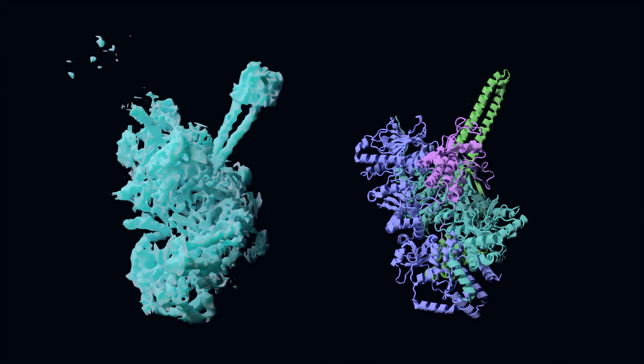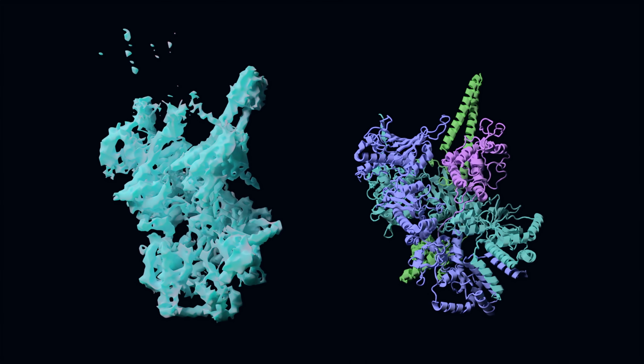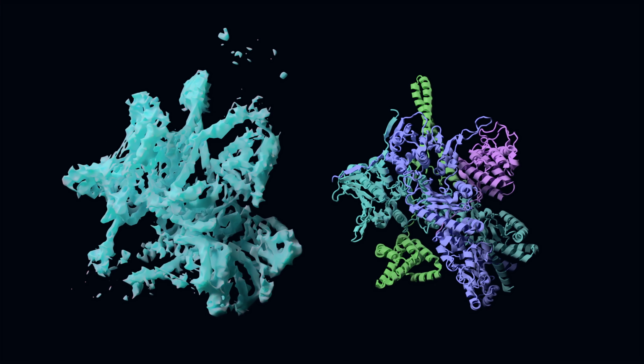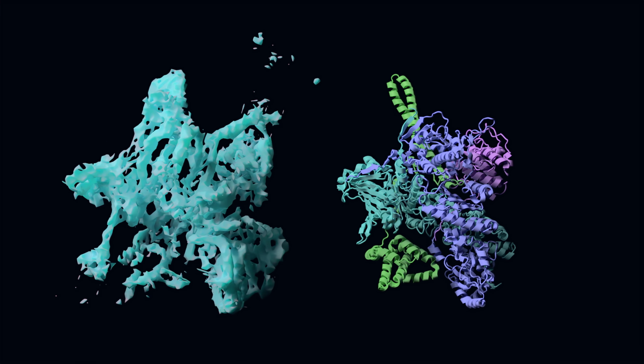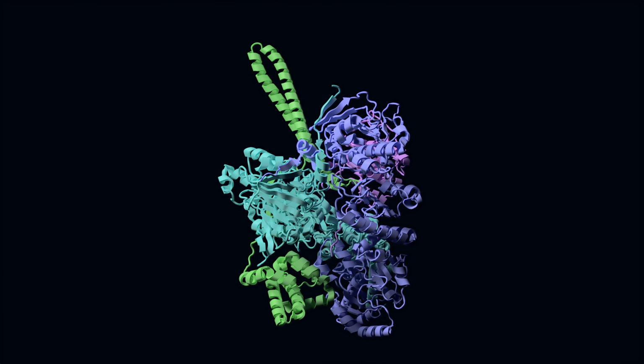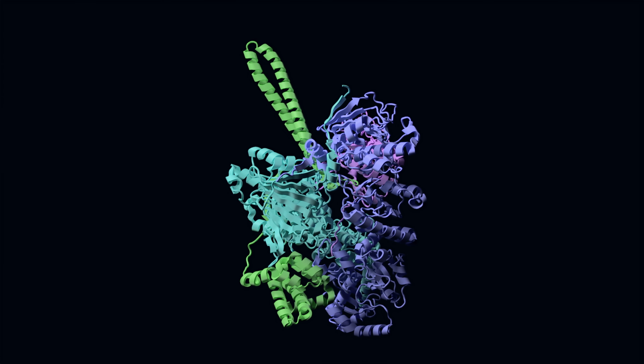Next, AlphaFold-predicted structures, or any other structures, are fitted into the refined map using Vesper, our structure fitting program. Finally, DiffModeler assembles the full protein complex by combining the best fitting poses of each subunit using specialized algorithms. Thanks to this diffusion model, DiffModeler can assemble protein complexes via fitting at resolutions that most other methods can't handle.